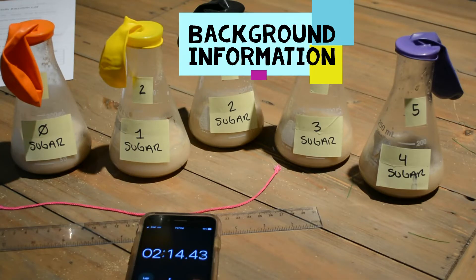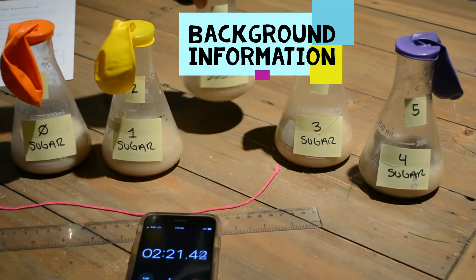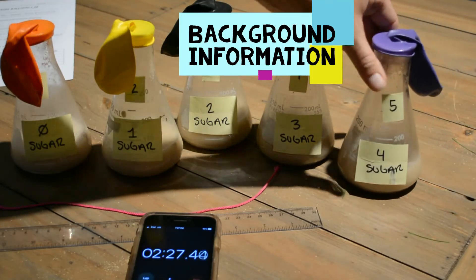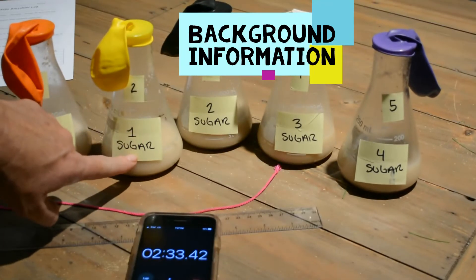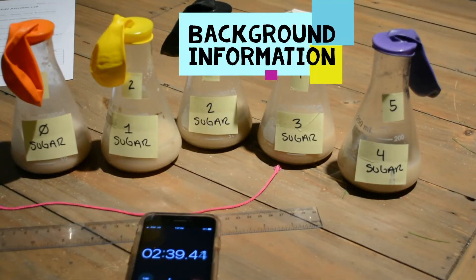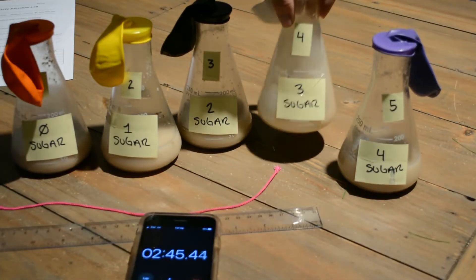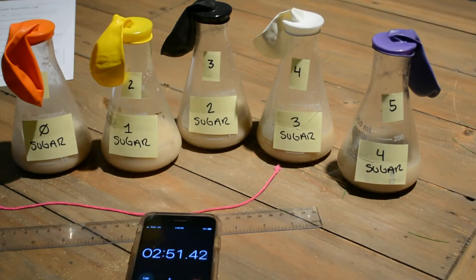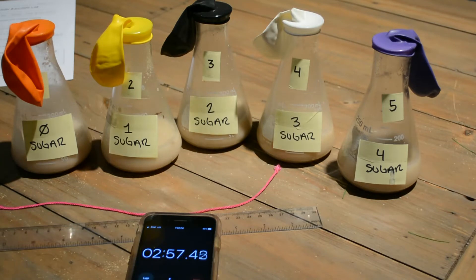Today we're comparing the rate of carbon dioxide getting captured in these balloons. We're going to see whether keeping one teaspoon of yeast constant while adding more sugar causes the yeast to produce more CO2, or whether the yeast are limited in how much sugar they can break down — so it doesn't matter how much sugar is added relative to the amount of yeast organisms.